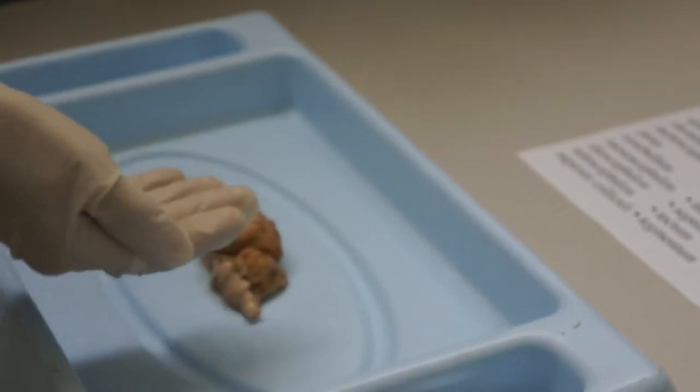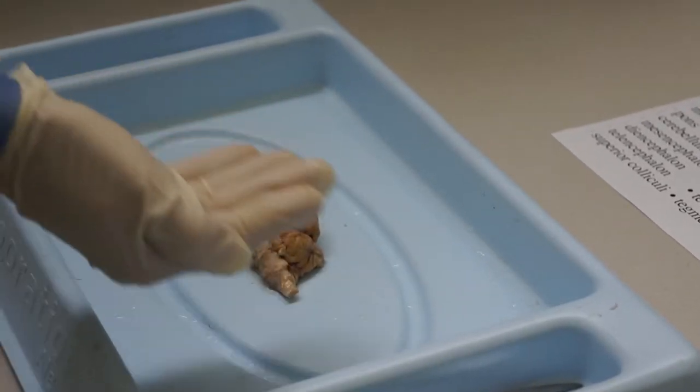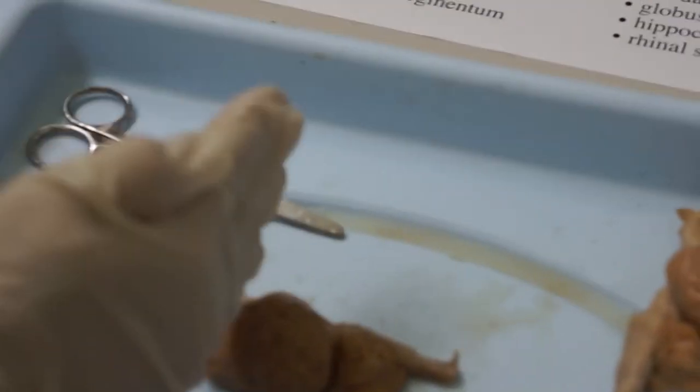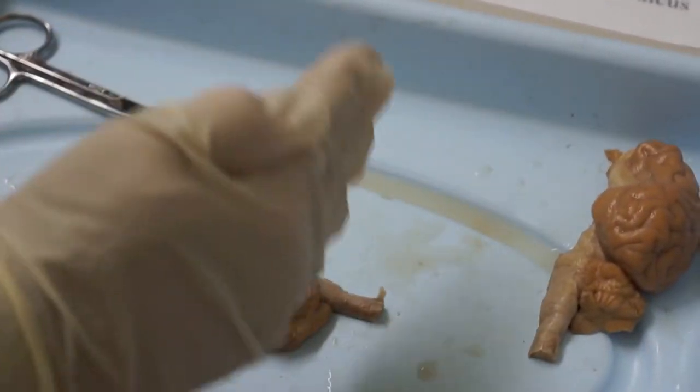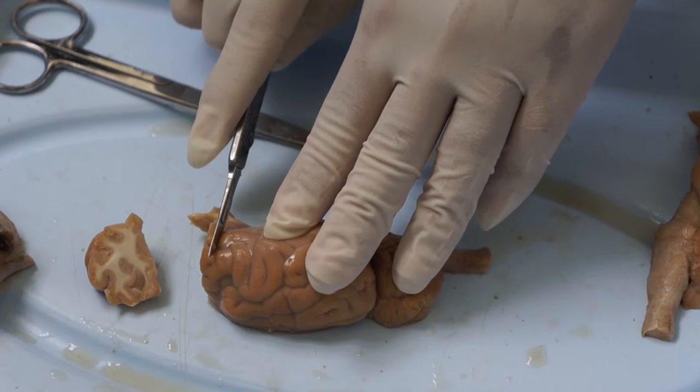This one, let's cut sagittally, which means slices like this all the way down. With this one, I want you to cut it in what we call frontal sections, or coronal sections, like this. So, get to it.